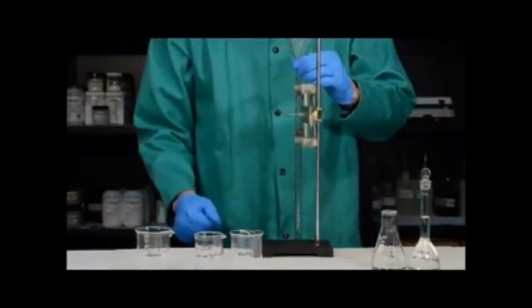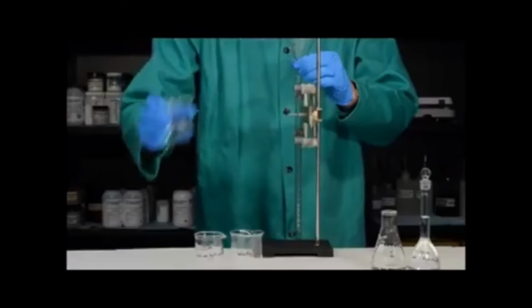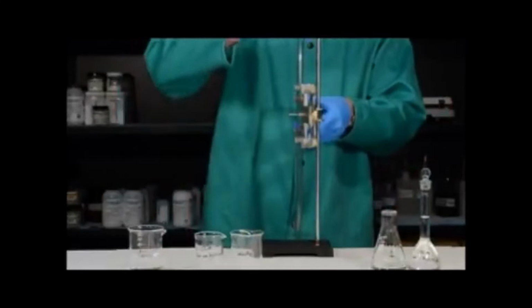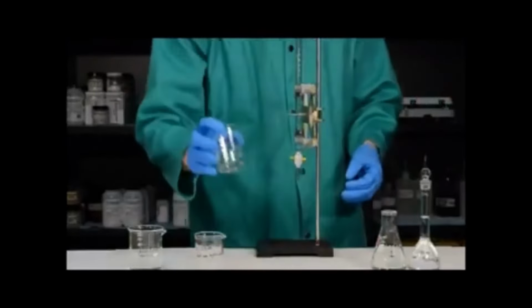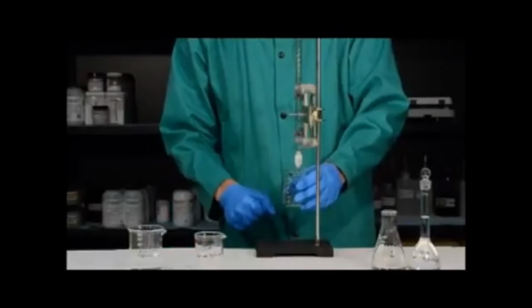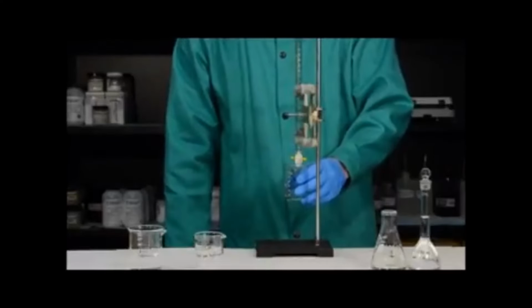We want to rinse the burette with about 3 portions of 5 milliliters of water. This doesn't need to be exact. So I'm just going to take my beaker of water and I'm going to add in about 5 milliliters. Then what I want to do is simply open the stopcock at the bottom and allow the water to flow out. So you can see this on camera, I'm going to go ahead and pull the burette back up, although when you're doing it, this probably isn't necessary. I'm then going to take the waste beaker and flow the water out of the burette and into the waste beaker. Once the burette is empty, I'm going to close and repeat this process 2 more times.